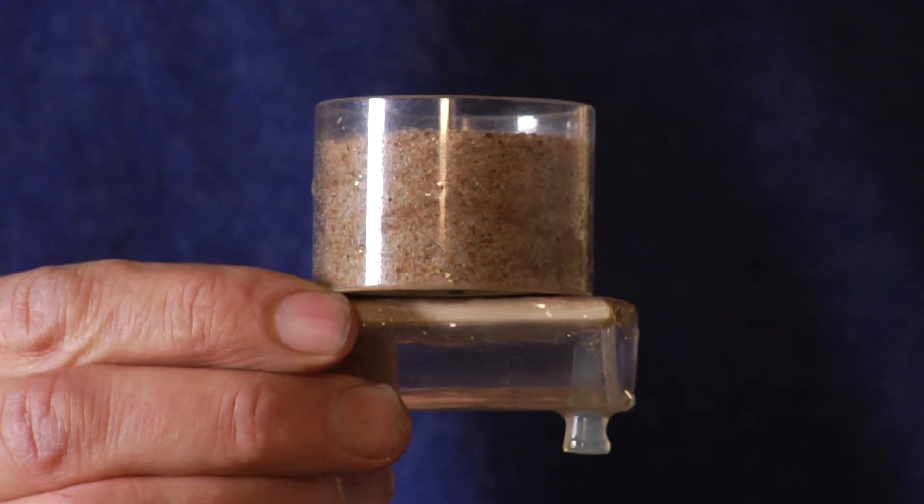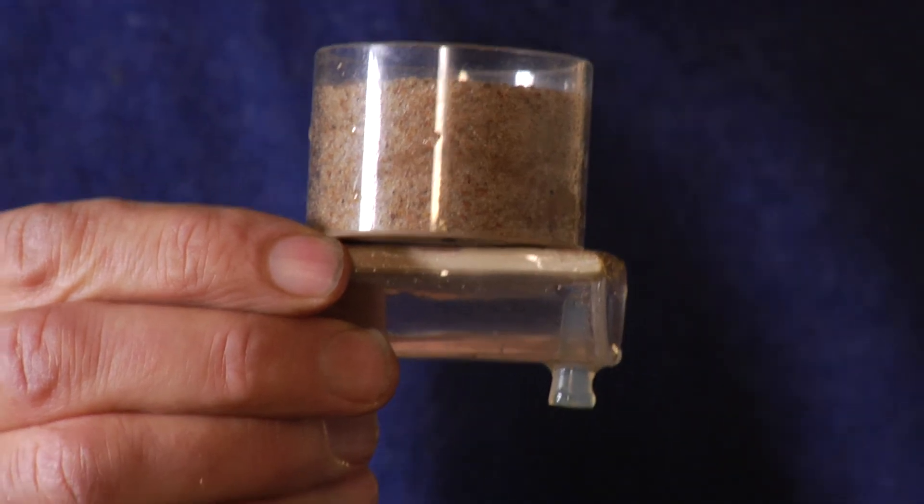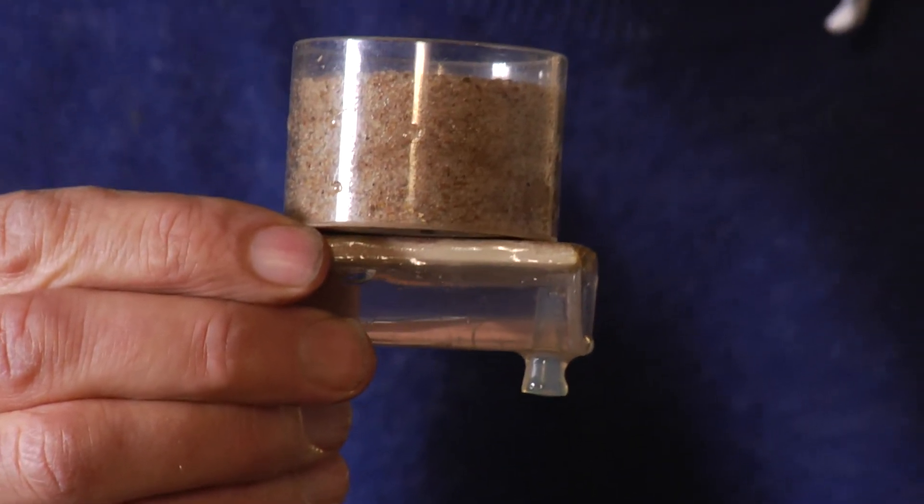This is a rather coarse soil, and very little water is dripped when I continue the lowering. Most pores were emptied before the negative pressure reached about minus 30 centimeters.